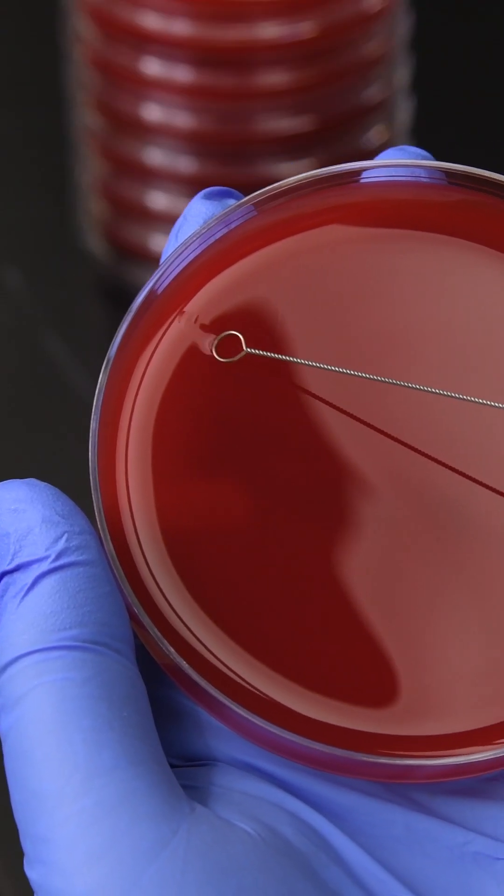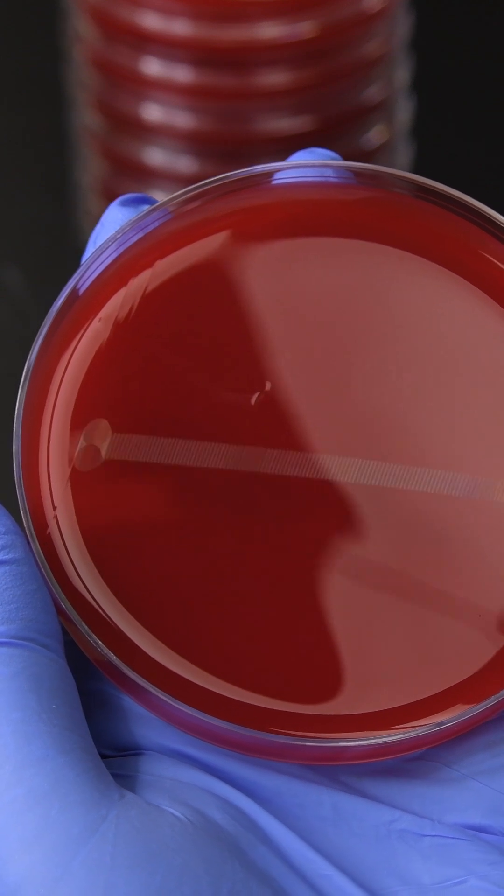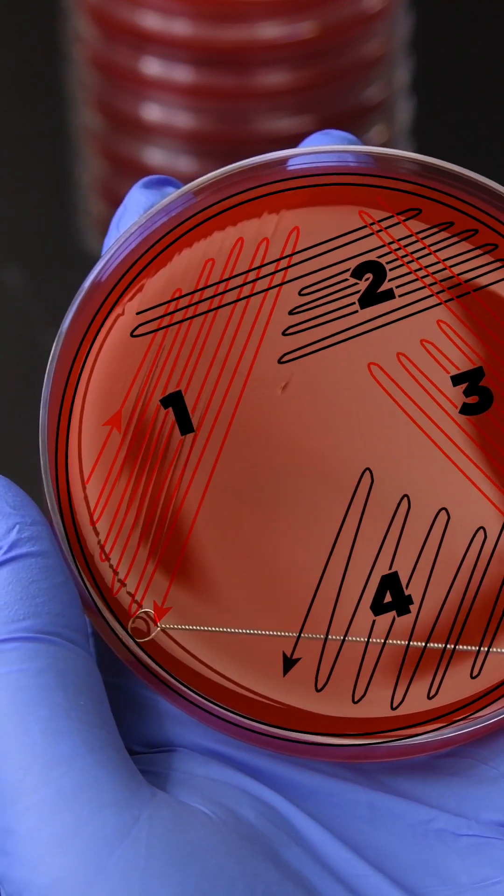Streak the sample using a sweeping motion from side to side across quadrant one, approximately a quarter of the agar surface.